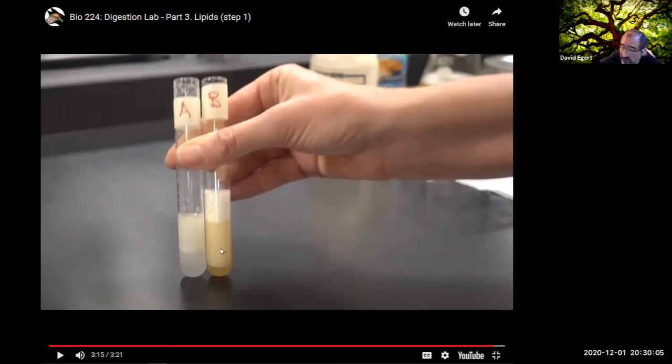But this is kind of giving you a sense of what happens when you mix water and oil with bile salts. They stay mixed together in this big emulsification layer rather than just separating out into a big block of fat in a block of water. Again, this is why the enzyme is going to be able to be much more efficient, because it's got way more surface area to attack.